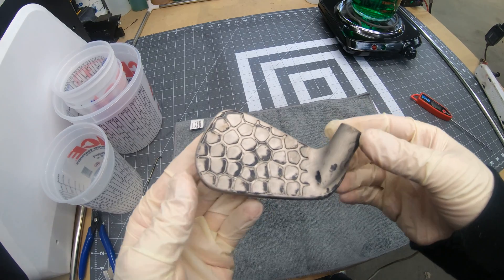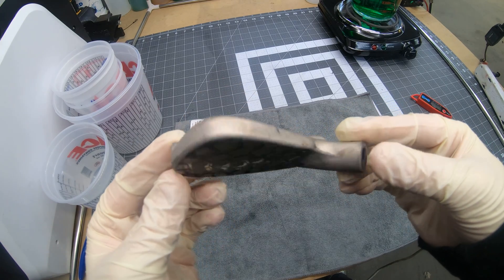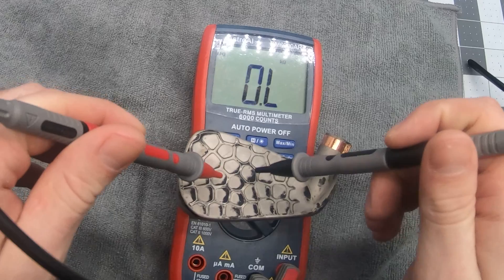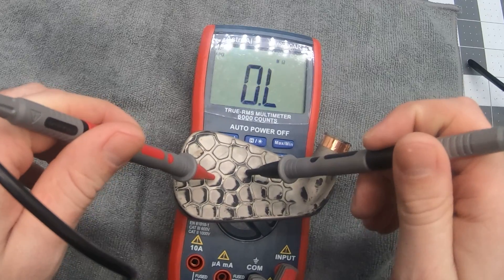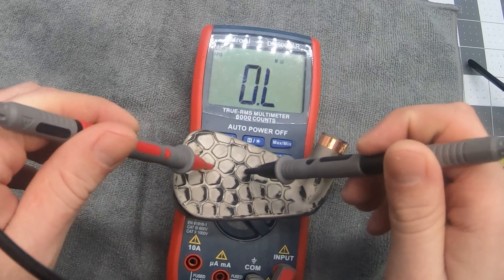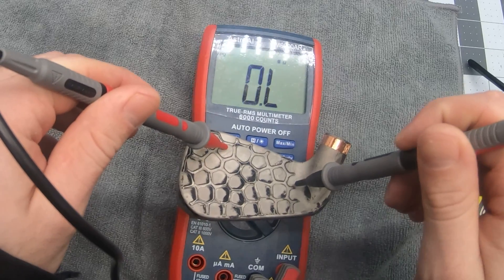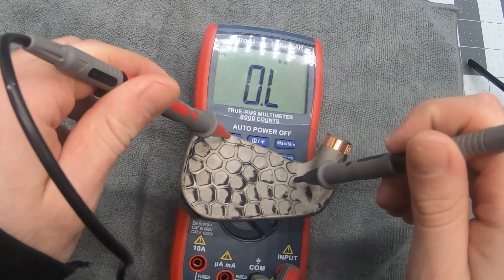I quickly nickel plated it and the results were kind of interesting. The backside plated nicely. And it was also still conductive, which wasn't shocking. The weird part was the Voronoi pattern created these conductive islands. Apparently the nickel doesn't like to plate on hard edges.